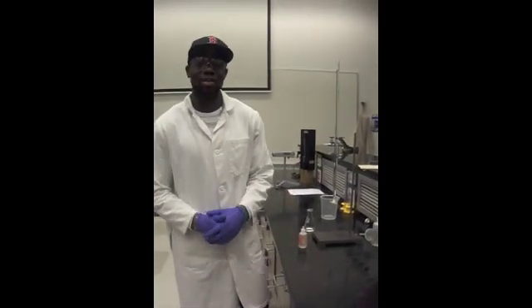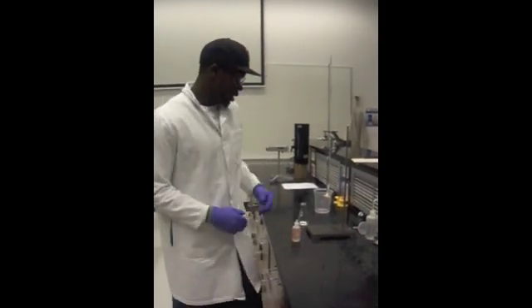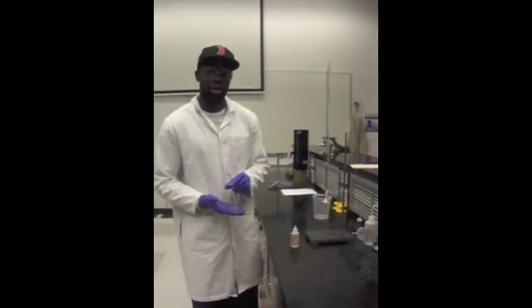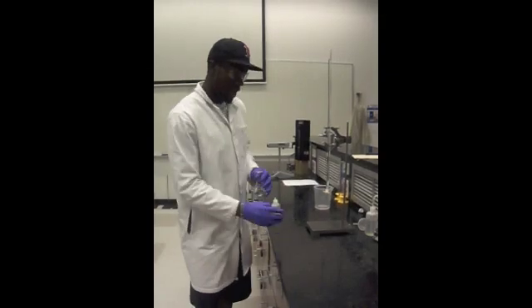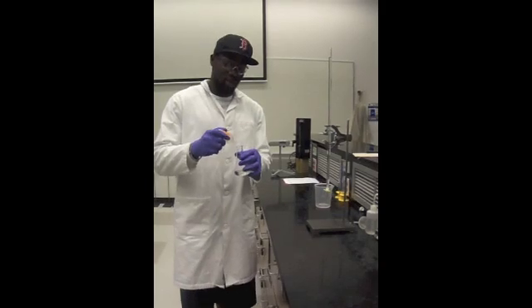Part three of the experiment is standardization of the sodium hydroxide solution. You're going to take your solution of KHP that you prepared and add about three to four drops of phenolphthalein to the solution.